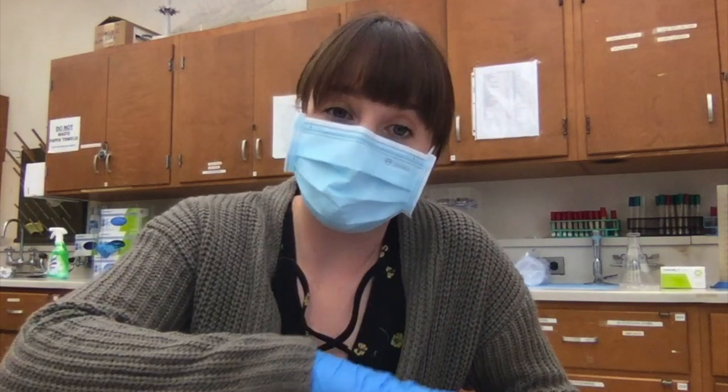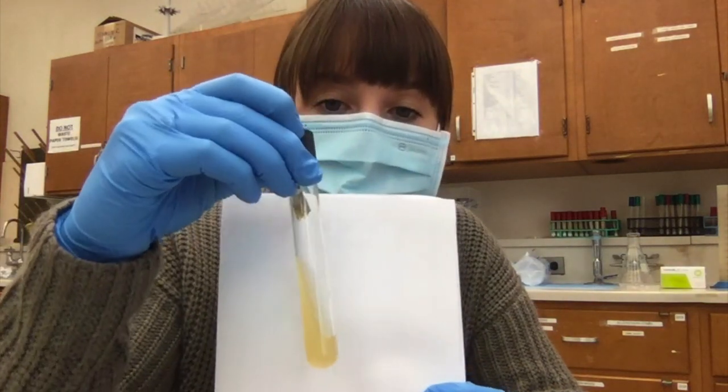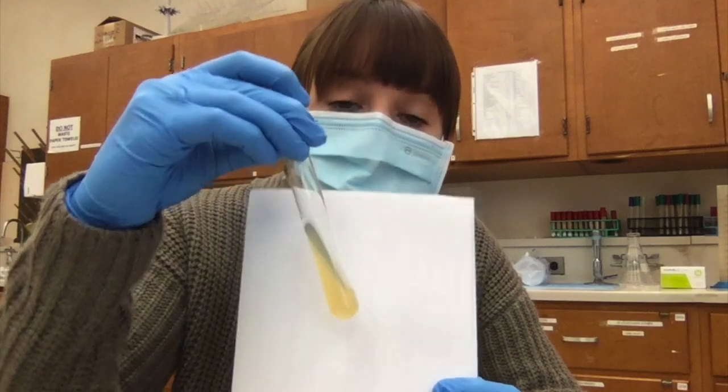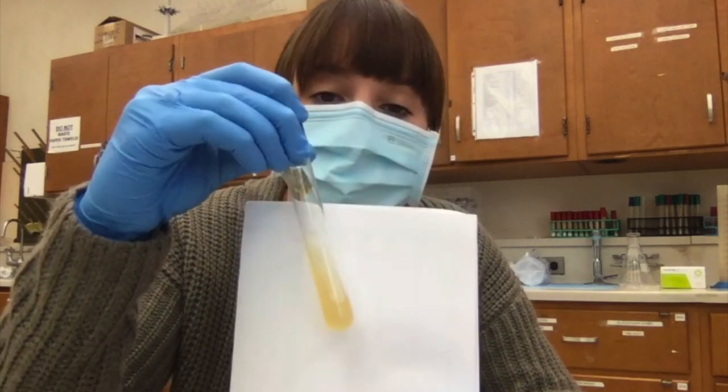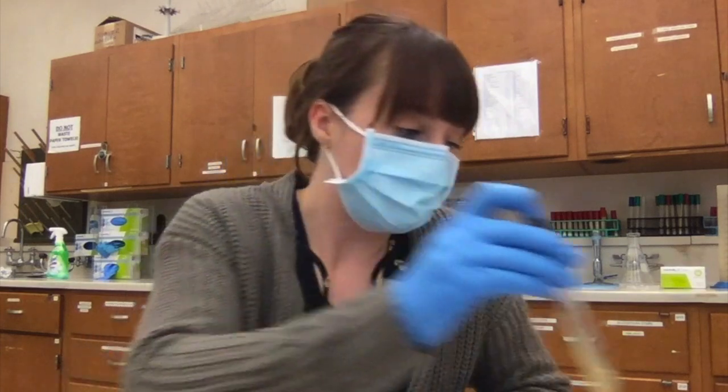The other things that we make are slants. Some of the issues that can happen with slants are, one, they're not slanted enough, which makes it difficult for inoculations, or they're slanted so much that they're completely laid over, or we can have contamination. First I'll show you a successful slant that would be easy for inoculations, and they look like this. These are used for longer term storage, up to a couple of weeks, so that you can store organisms and they can stay alive.